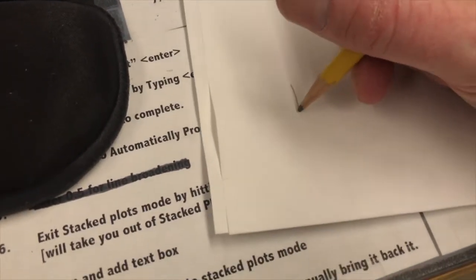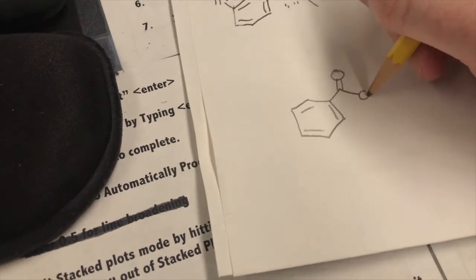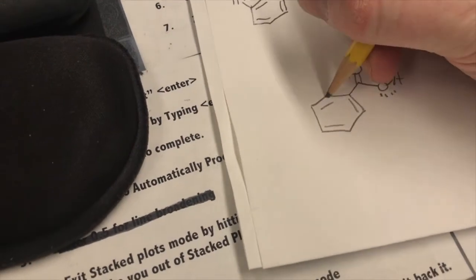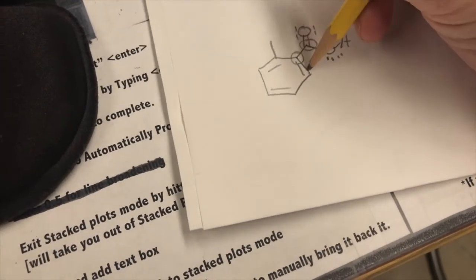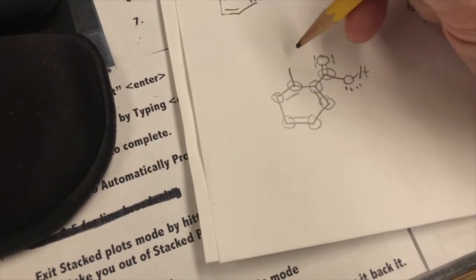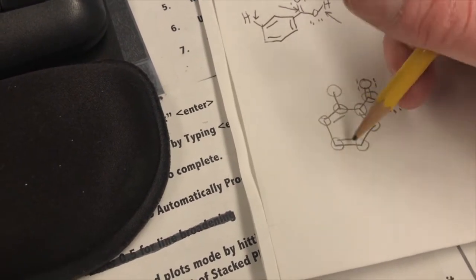So it looks like we have o-Toluic acid, right? So how many carbon signals should we have? We should have the carbonyl signal around 180, 175. Aromatic, all the aromatics are unique. So 6 in the aromatic region, like 100 to 150. And then the methyl is at about 25, 30 or so. So let's see, how many is that total? 6, 7, 8. So I'm hoping we get all 8 carbon signals.